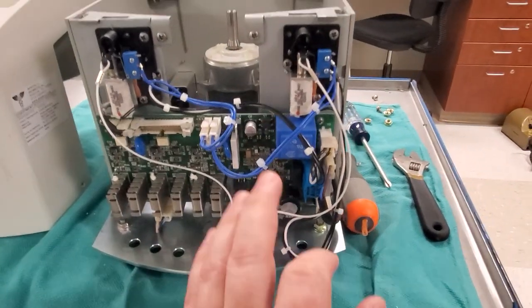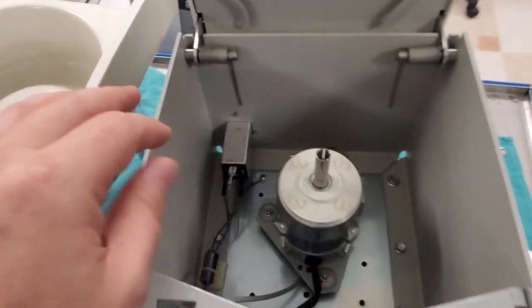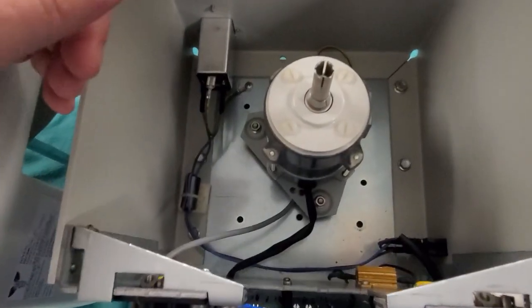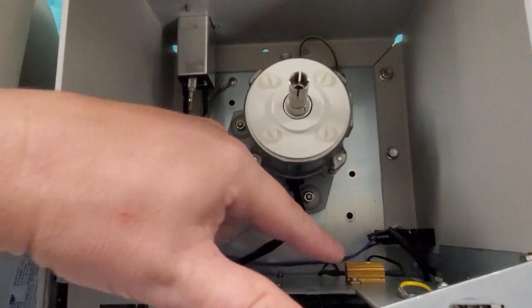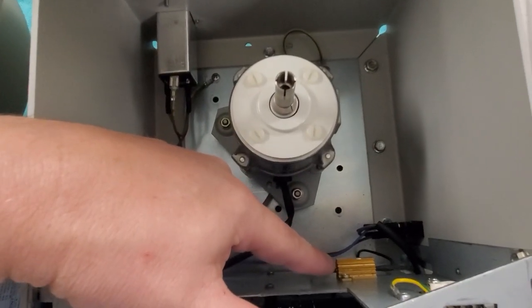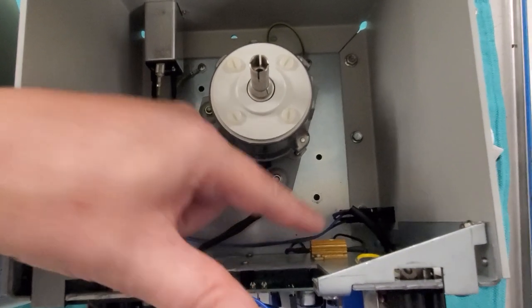You've got your door detects. You can see it's very simple inside. They have a little noise choke right there. This is an important part — this is a braking resistor and they all have this braking resistor in some capacity.